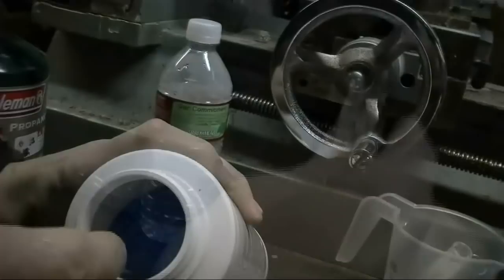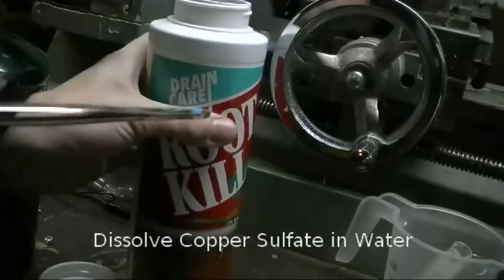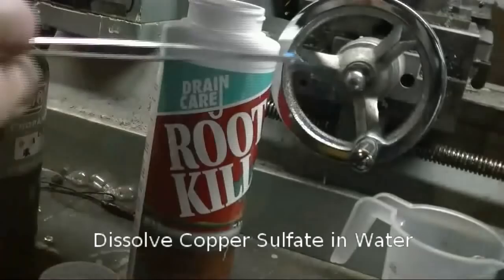I added more copper sulfate, just a very little bit. The percentages we're talking about in this process are a few hundred parts per million.